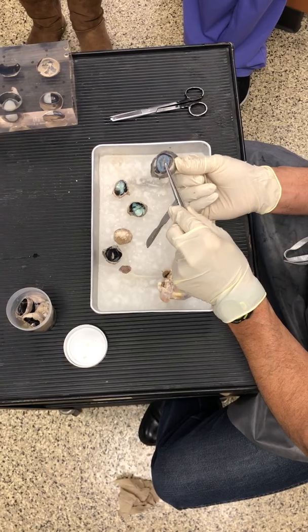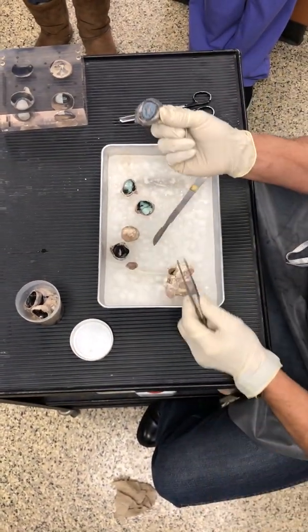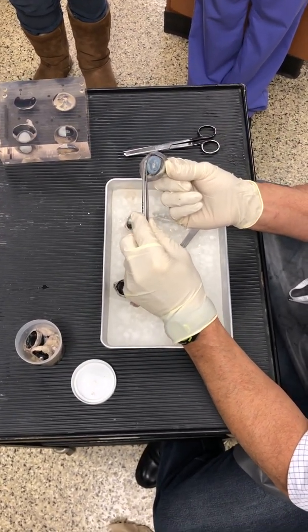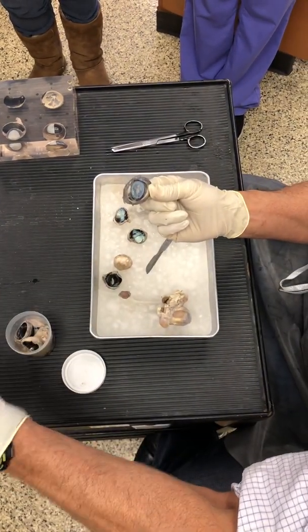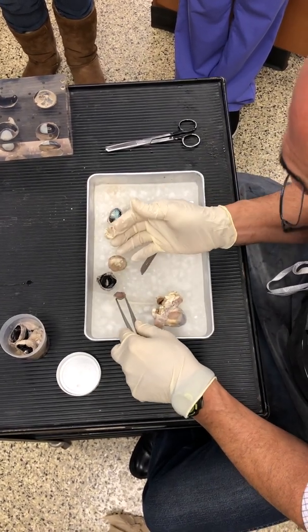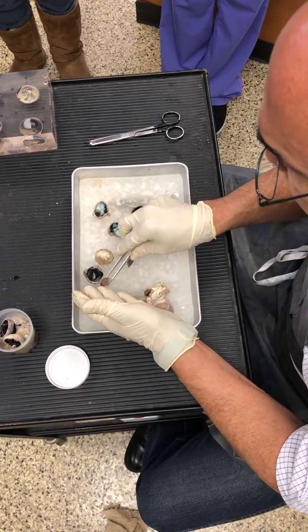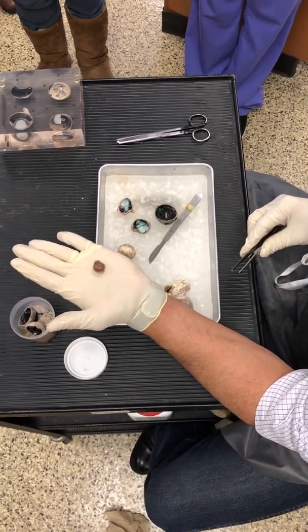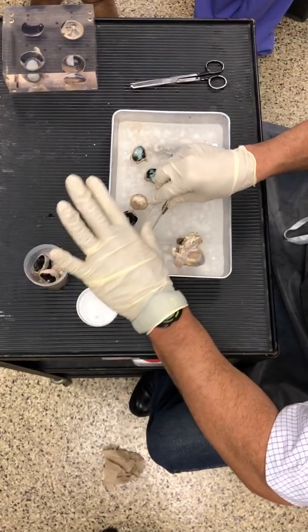But if you look at your dog or your cat, you can see a nice semicircular cornea. Colorless, glass. This is dead. So soon after death, the proteins in the cornea start to break apart, and the clear glass-like becomes opaque. Much like the lens, folks. There's the lens. Our lens, we are alive, so our lens is colorless. The proteins start to break apart after death, and it becomes that opaque texture.